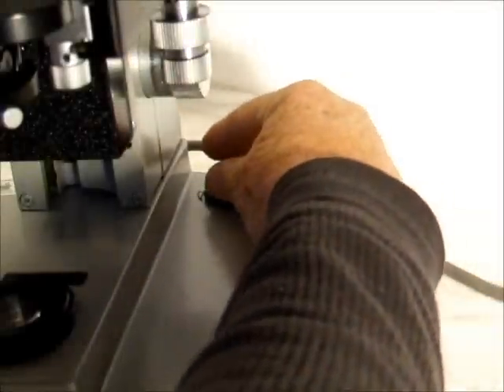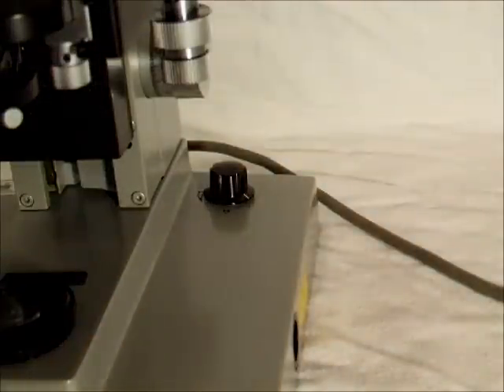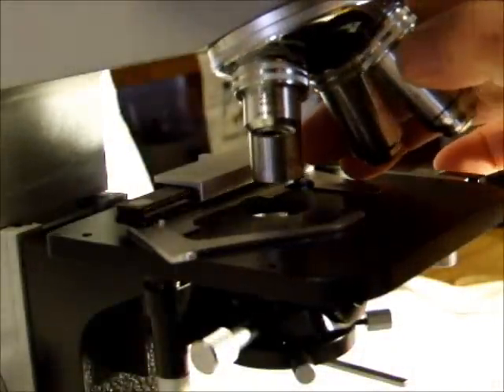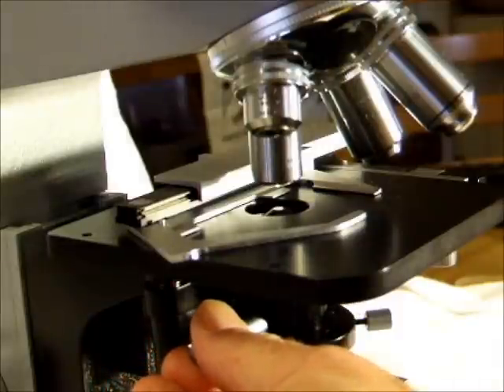The first step is to turn on the light and adjust it to its maximum intensity to get the proper light spectrum. Step 2. Place the 10x objective lens into position and make sure that the extra condenser lens is also in position at the top of the condenser.